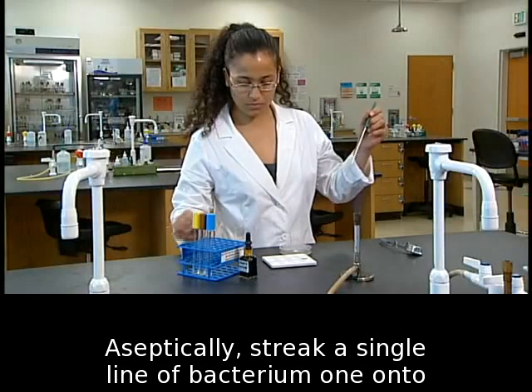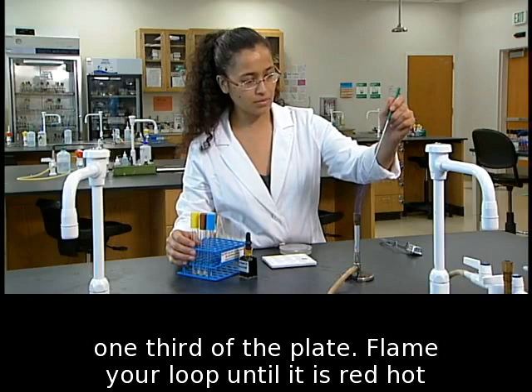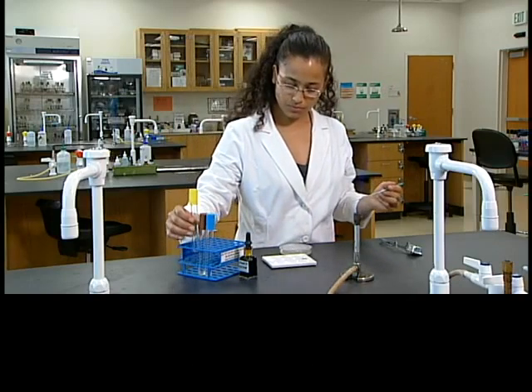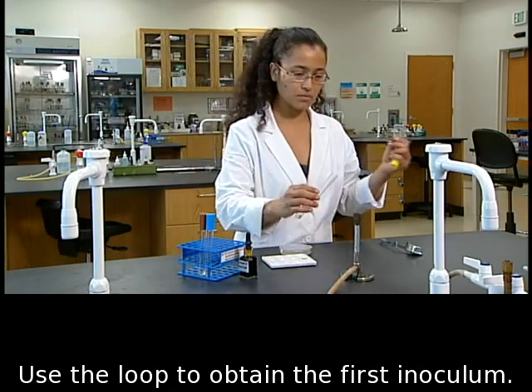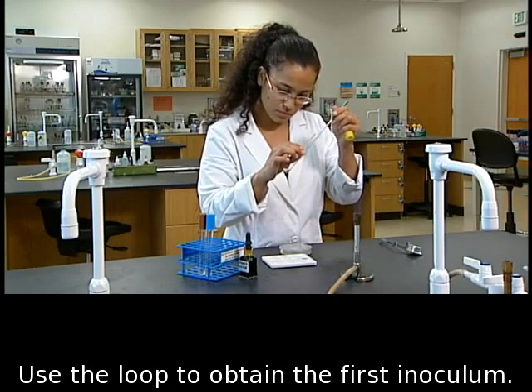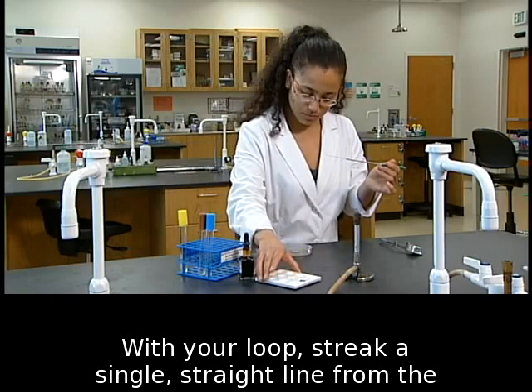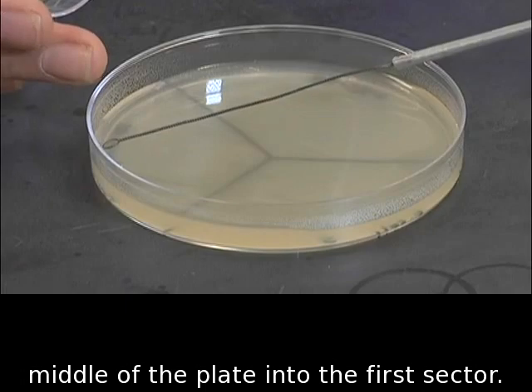Aseptically, streak a single line of bacterium 1 onto 1/3 of the plate. Flame your loop until it is red hot and let it cool. Use the loop to obtain the first inoculum. With your loop, streak a single straight line from the middle of the plate into the first sector.